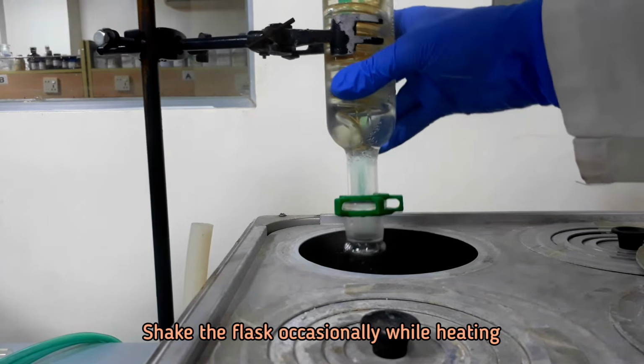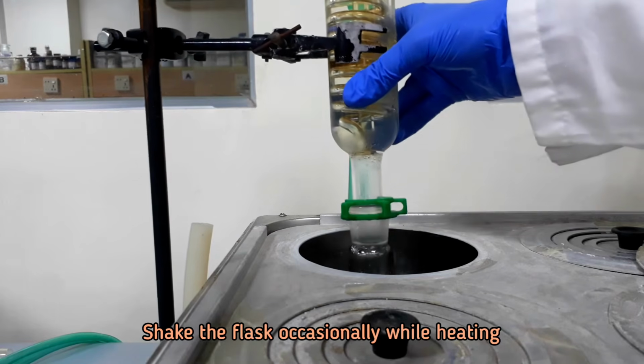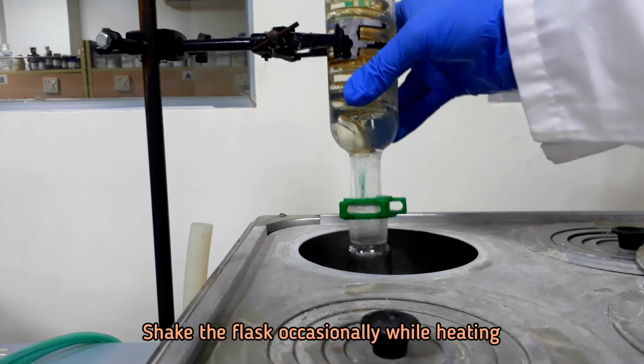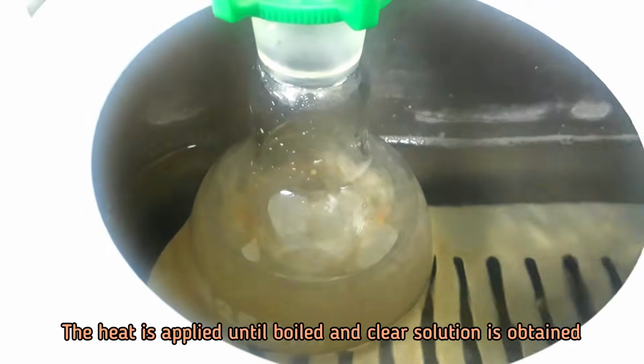Shake the flask occasionally while heating. The heat is applied until a boiled and clear solution is obtained.